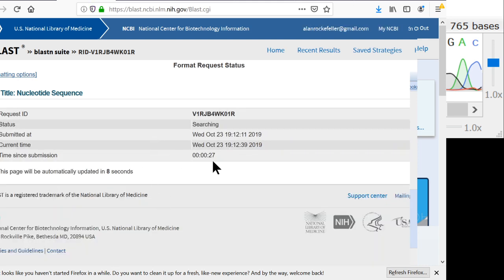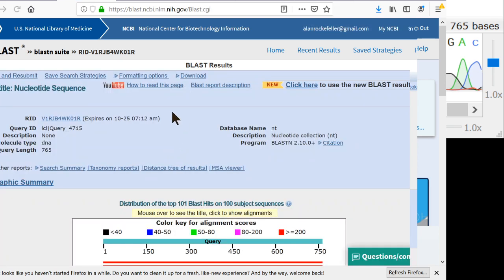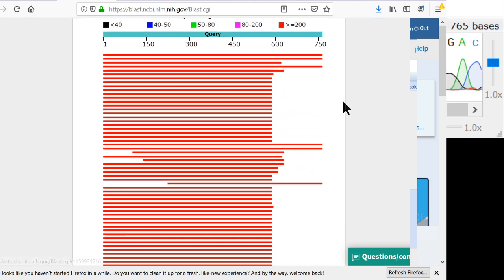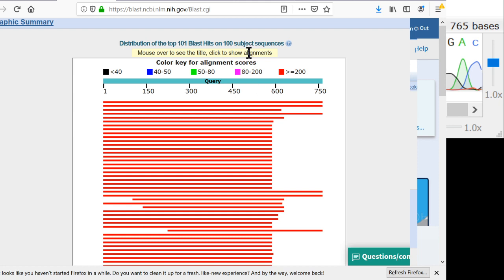Here it's probably taking a little longer than normal because I have a long sequence, because the ITS4B primer is a little bit further than the primers people usually use. But here it's finished. Looking here, we can see our alignment scores in these red bars. What this shows is that we have a whole lot of returned sequences in our query. Their default parameters ask for 100 matching sequences, and that's what we got. Out of that 100, these red bars show how well our sequence overlaps with all the other sequences.